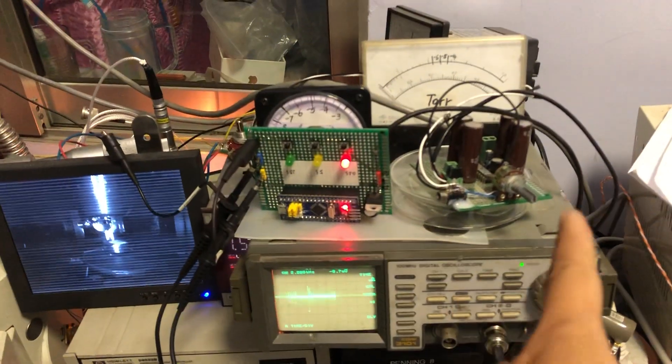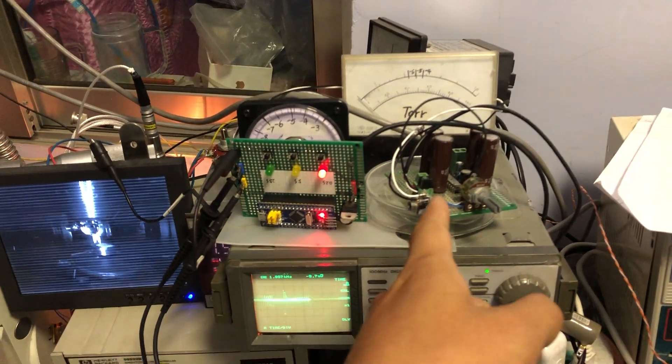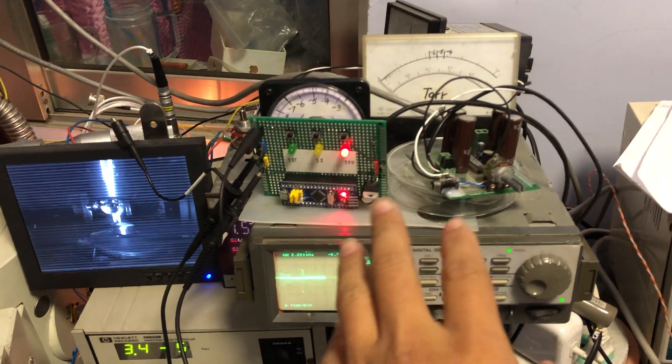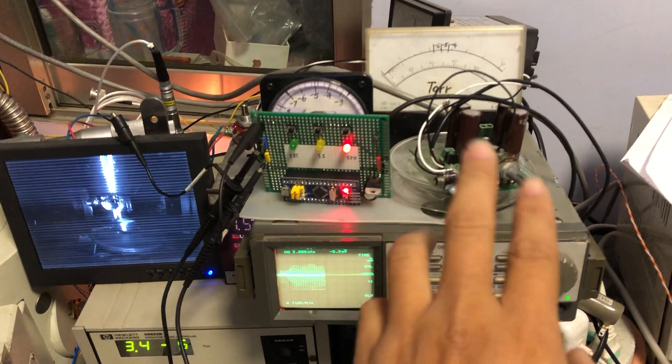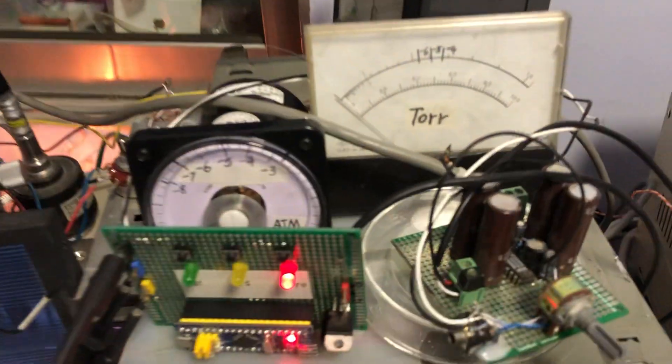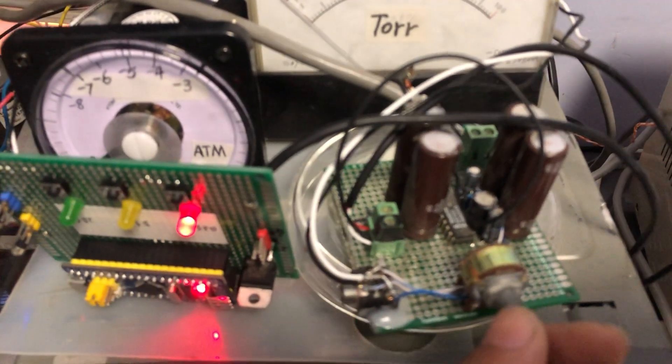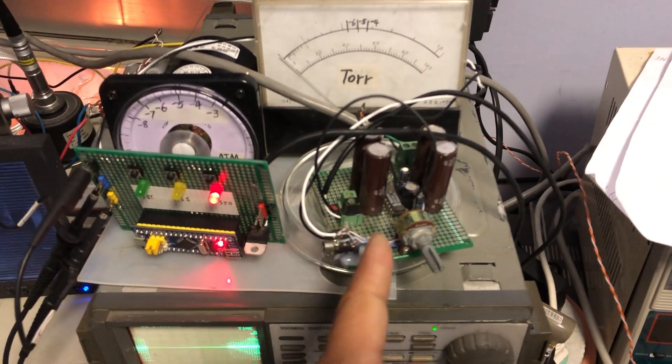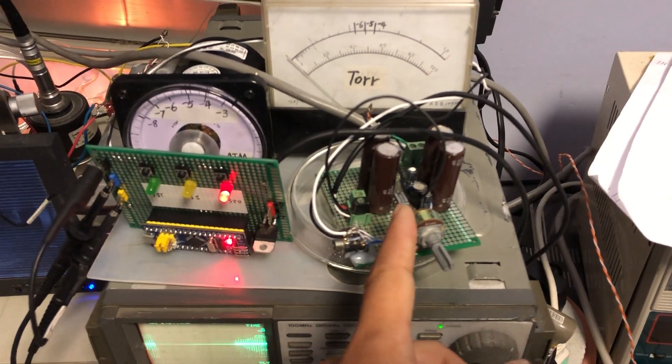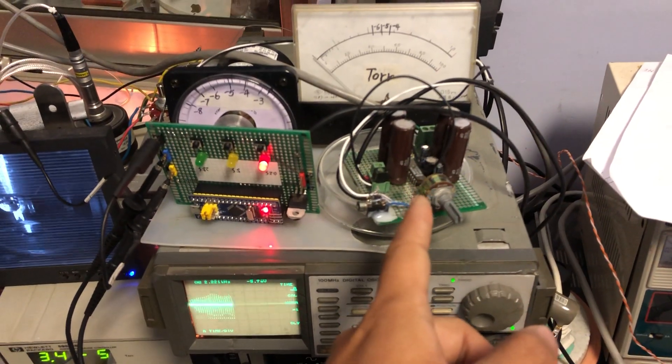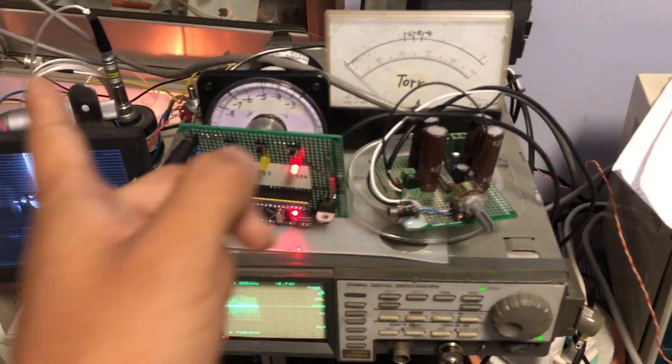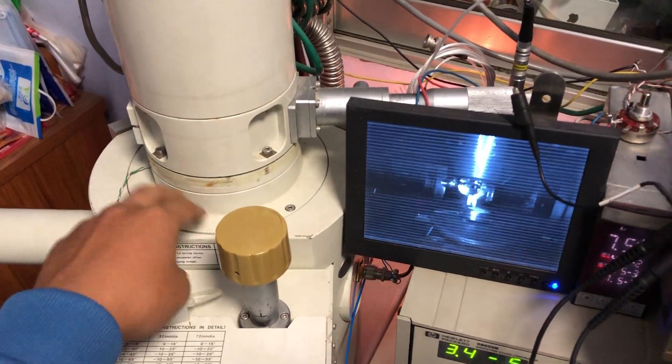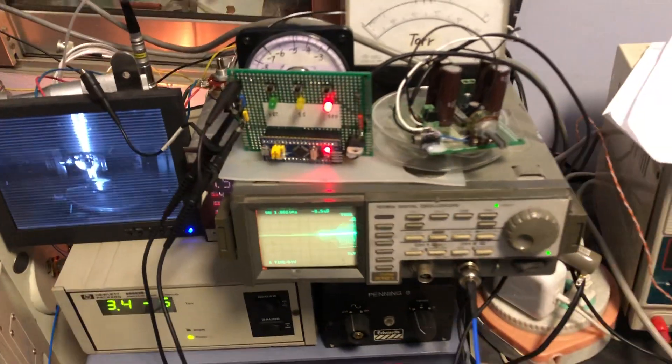Okay, here is the garbage amplifier that I'm using to test. Just a test, nothing serious. So here are the focus amplifiers that are driving the scanning coil down inside the sample chamber.